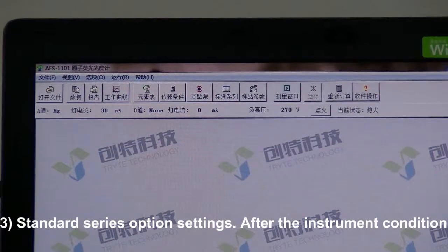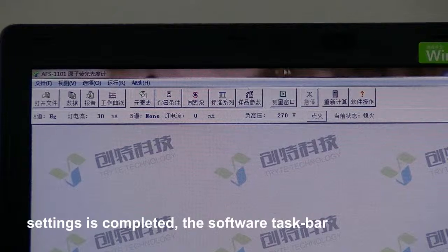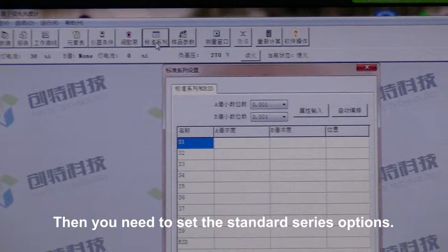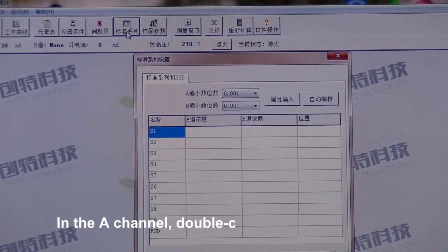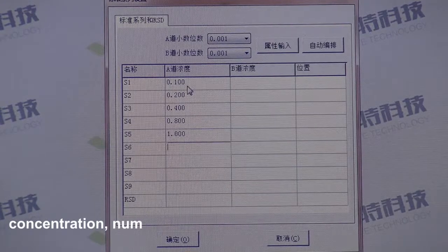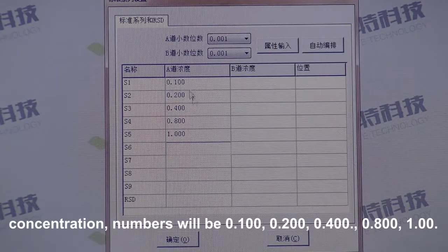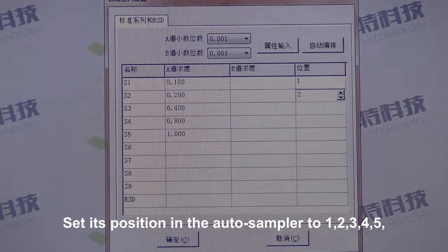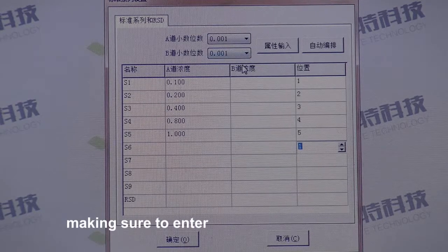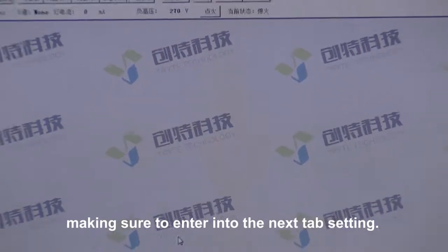Sub-step 3 — Standard Series Option Settings. After the instrument condition setting is completed, the software taskbar is fully open. Then you need to set the standard series options. In the table, double-click to input standard concentration values: 0.1, 0.2, 0.4, 0.8, and 1. Set their positions in the autosampler to 1, 2, 3, 4, 5, making sure to enter the next type setting.